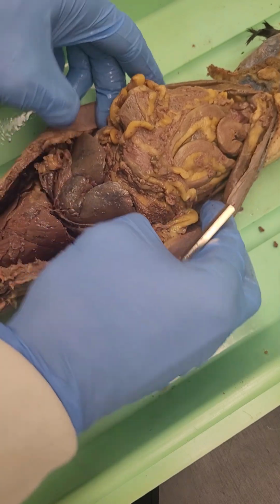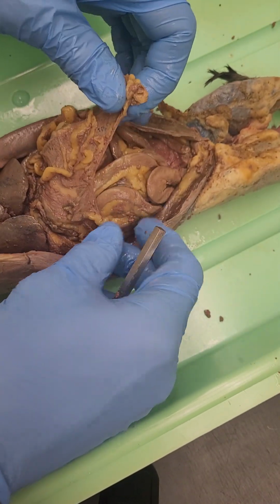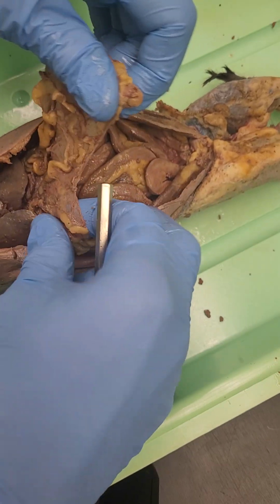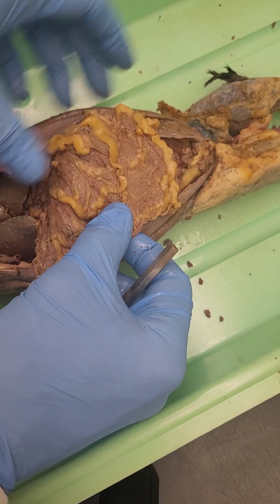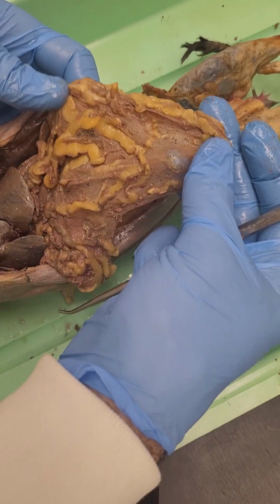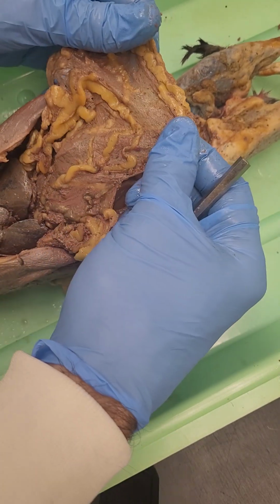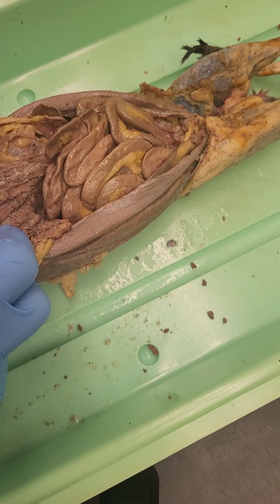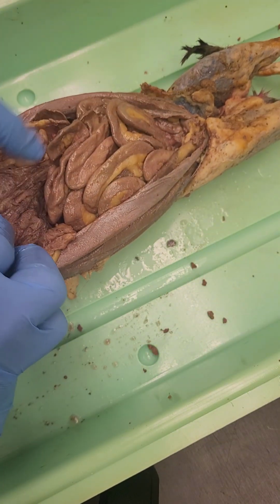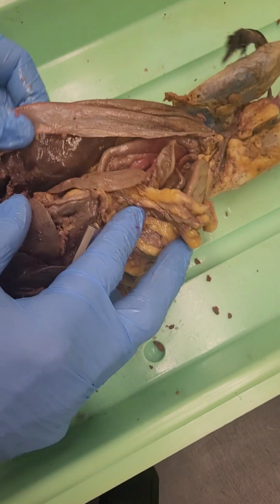Now, in the mammal, we have what's called the greater omentum, which is a large membranous structure which covers the abdominal organs, specifically the intestines. And so you can see that this is well vascularized with lymph structures as well, and it can be folded forward to reveal the small intestine and organs beneath. What we'll do is we'll focus on the region above this to start.